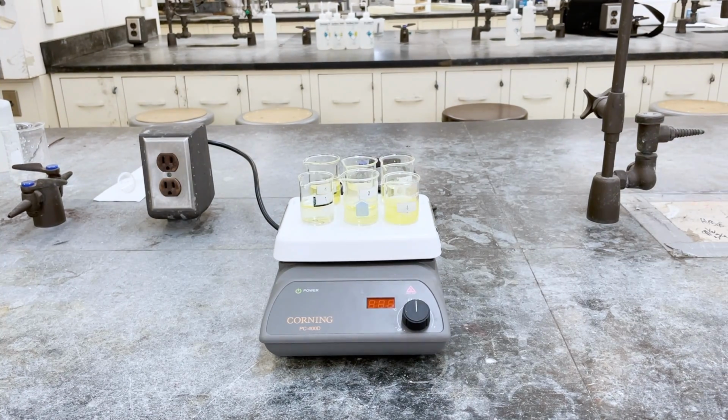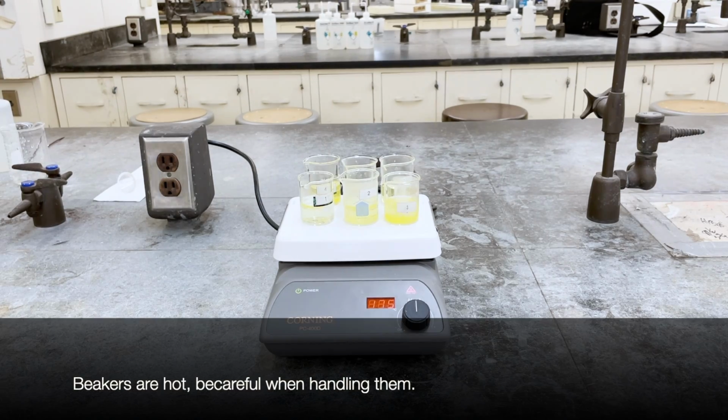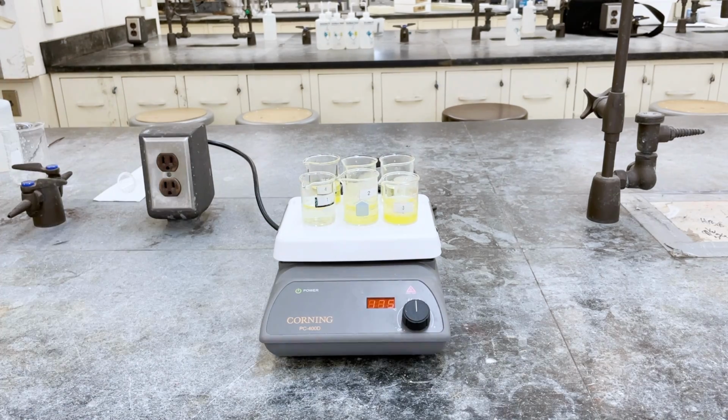Turn off the hot plates after approximately 7 minutes. Let the beakers cool on the hot plates for a few more minutes before setting them onto your bench. Wait a few more minutes before beginning the filtration.